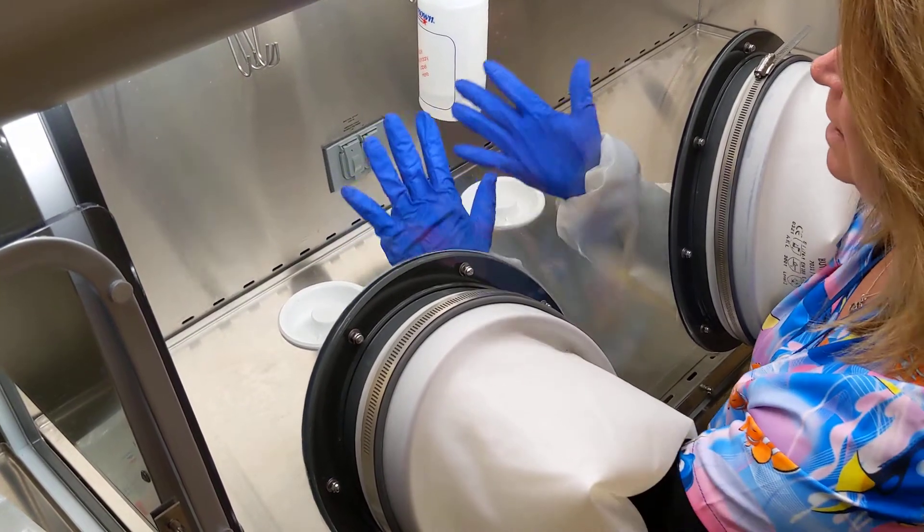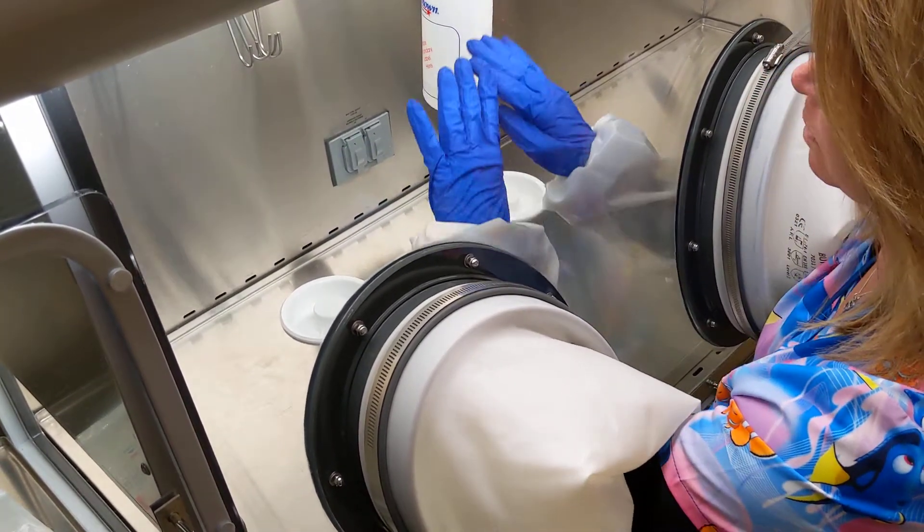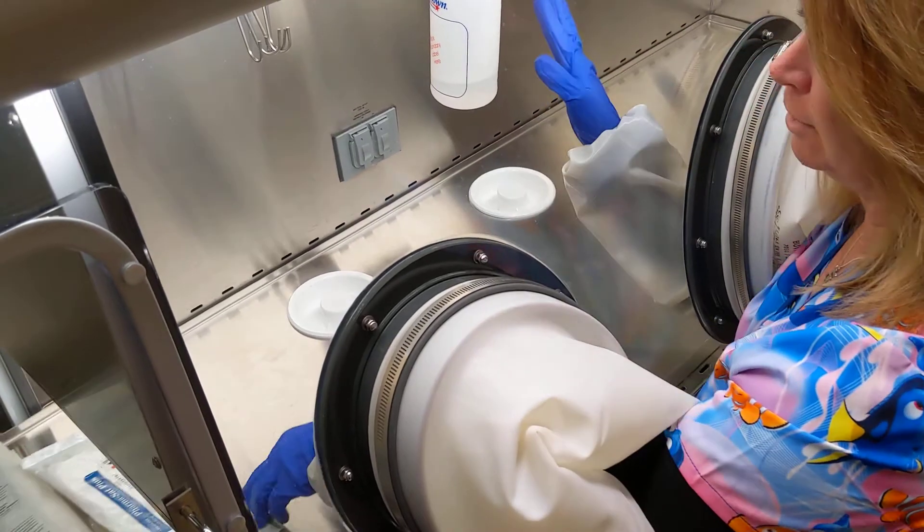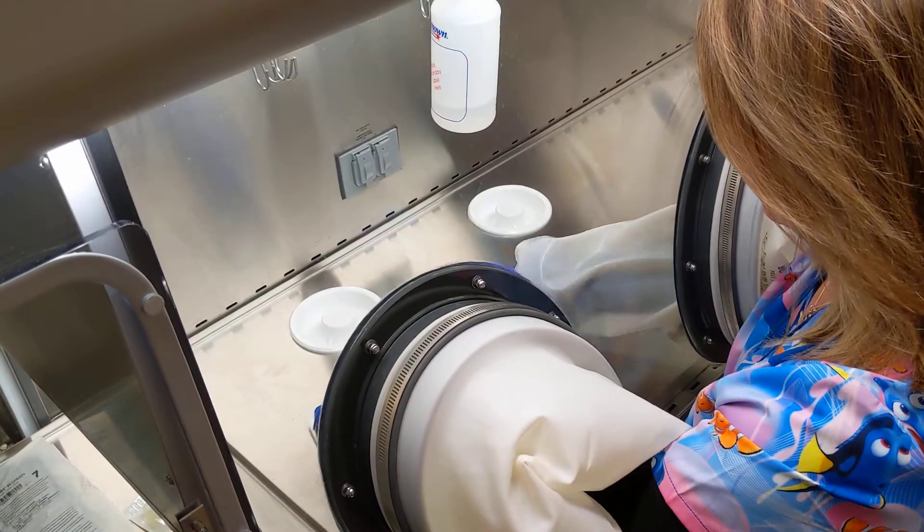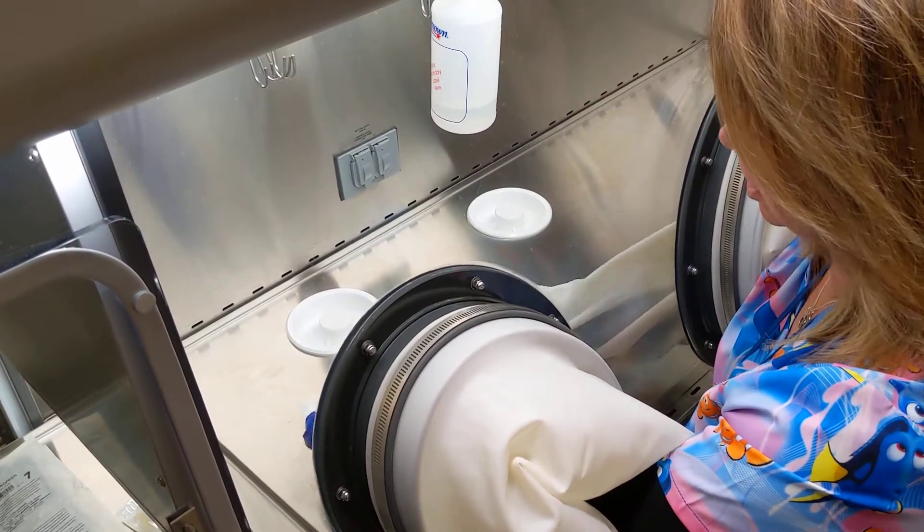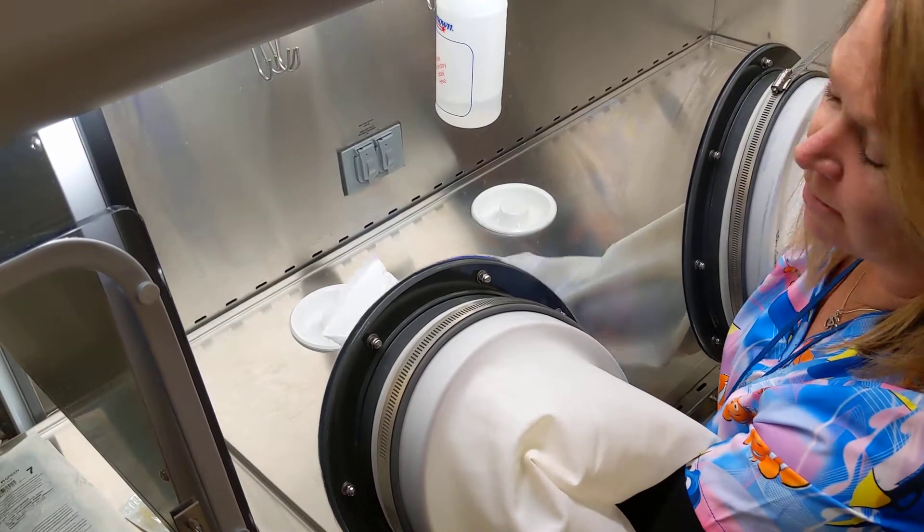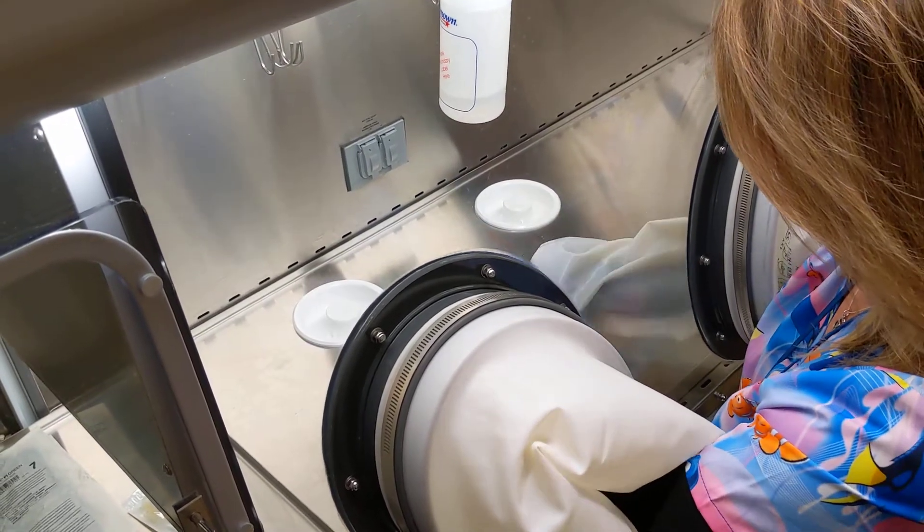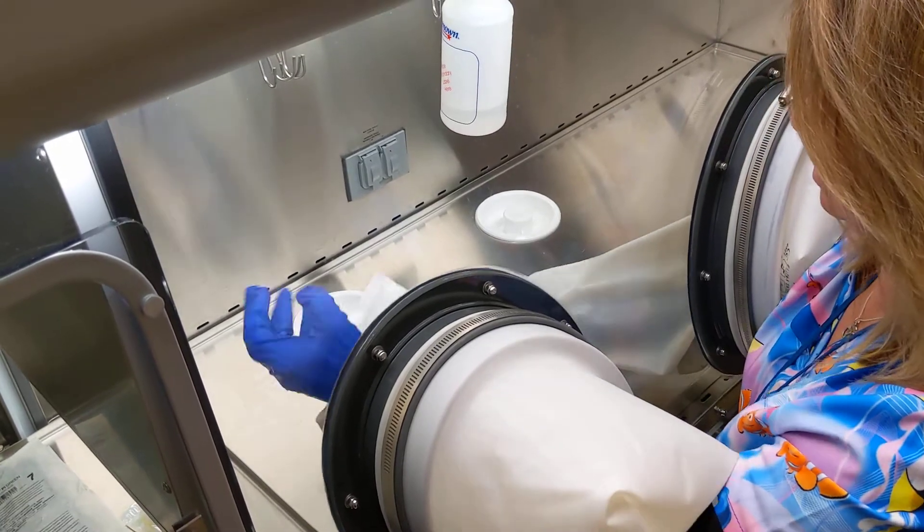I'm wearing cotton gloves underneath, and now these are the hood gloves which have been in this HEPA filtered air. This is the inner chamber door, so things go from the outside into that interchamber and then they're put in the inner chamber.